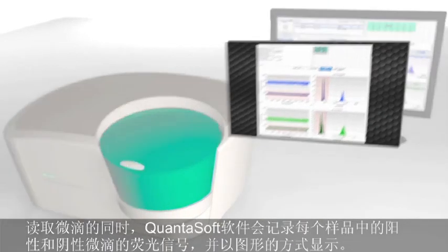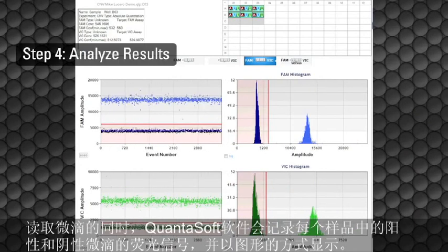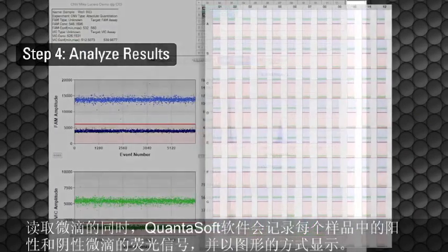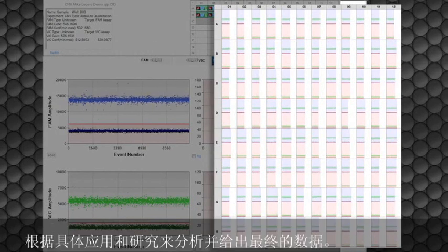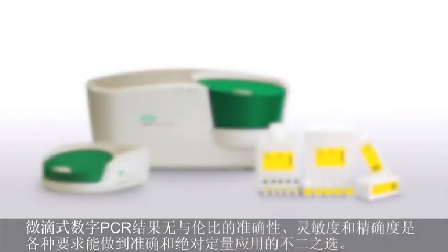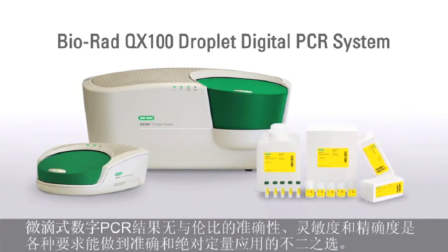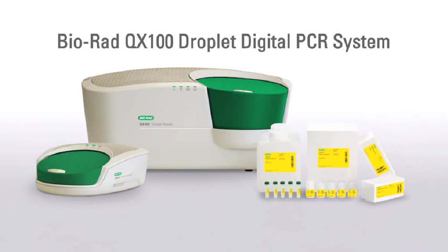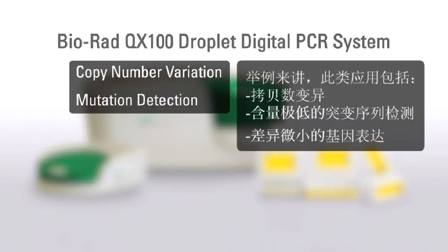As each droplet is read, the data are recorded graphically by QuantaSoft software. The software records the positive and negative droplets in each sample and plots the droplet-by-droplet fluorescence. This allows the data to be analyzed and visualized according to specific application and research requirements. The accuracy, sensitivity, and precision of droplet digital PCR enable a wide variety of applications that require accurate, absolute quantification. Examples of these applications include copy number variation, mutation detection, and gene expression.